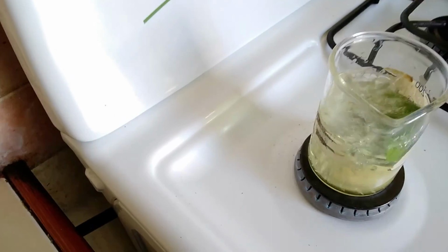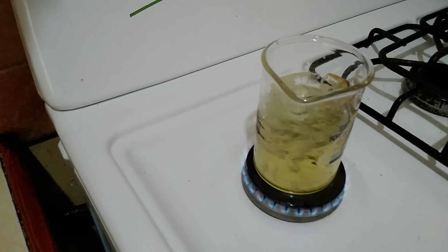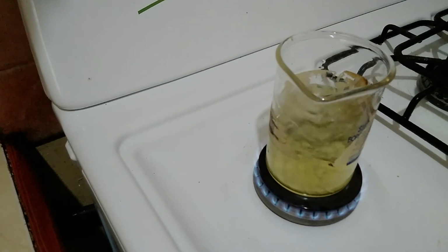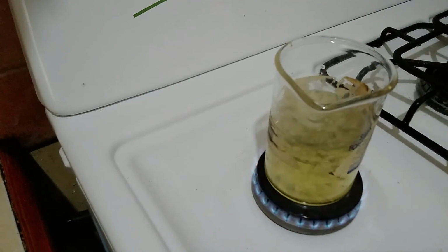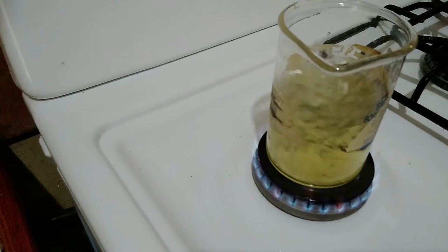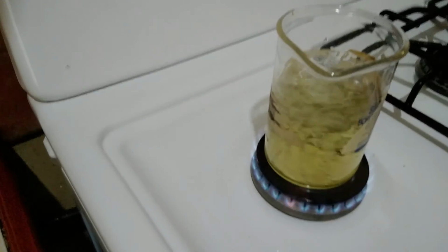All right, so we're going to remove this now. So you will remember when we removed the variegated leaf from the water, it had the clear color just the same. But having placed the carinilla leaf in the water, you observe that the color has somewhat changed. Now this is a part of your observation that you will need to record.